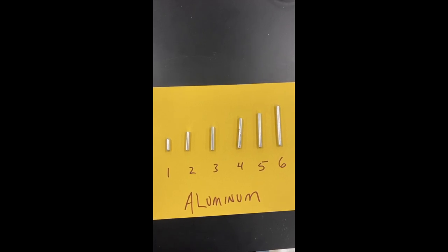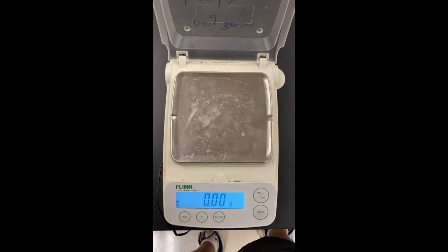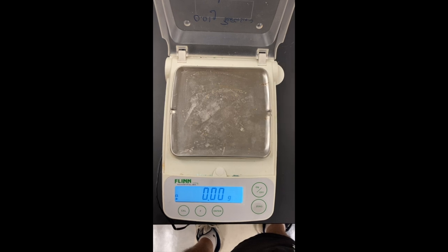Until you get to the sixth piece, which is the biggest of all of them. I've got a scale over here that will help us find the masses of the pieces, and you notice that it's at zero.